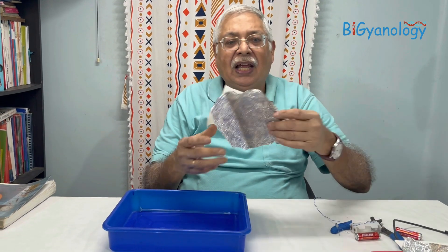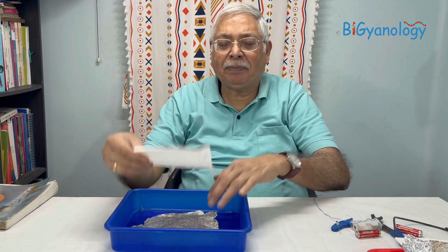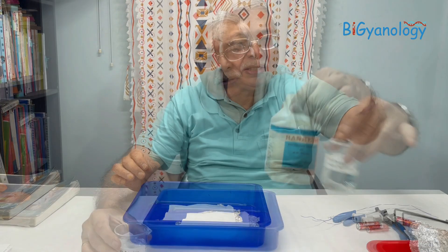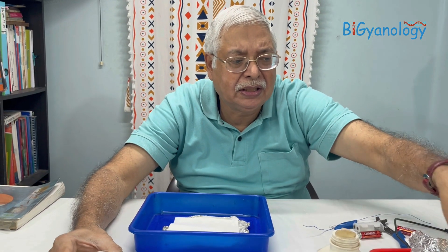For this experiment, I am taking an aluminum foil which acts as a conductor — anything will do — and a blotting paper which I am placing on the aluminum foil. We have also made a potassium iodide solution, about one percent or a very small amount; it doesn't need to be strictly one percent.